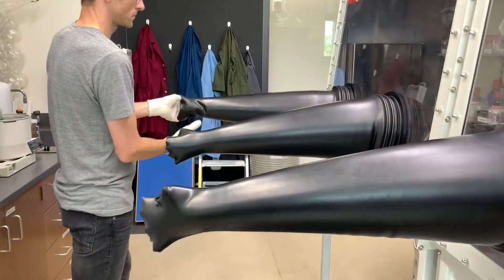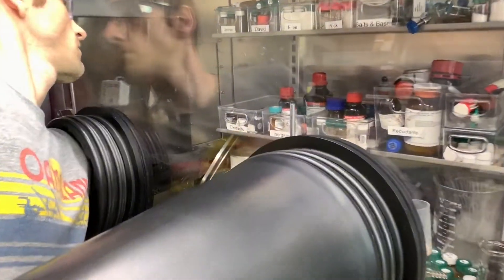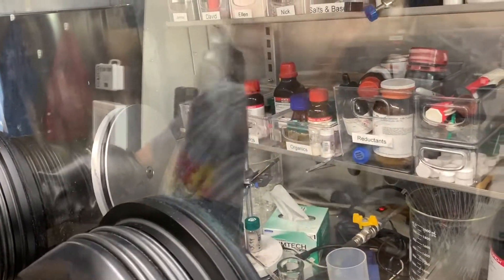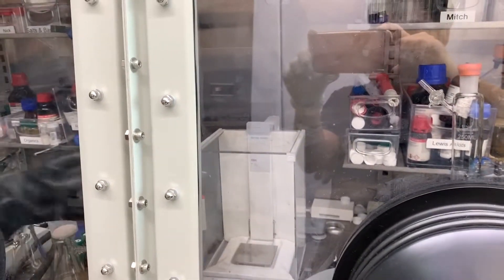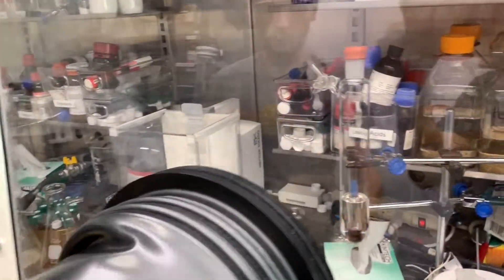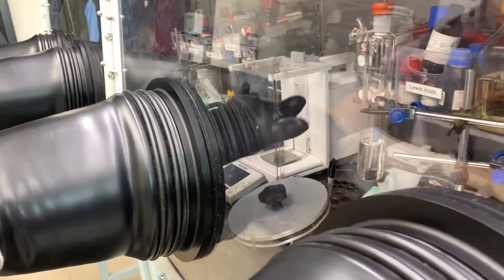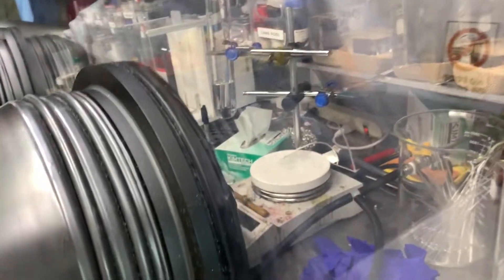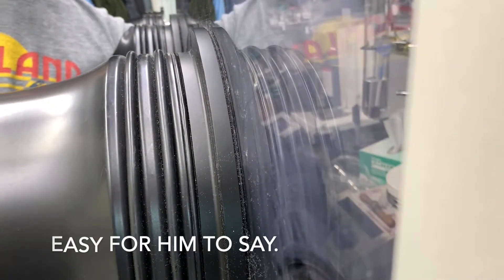In this case, the glove that needs to be replaced is on the far side of the glove box. Mitch will work quickly to move the porthole cover over to the other side, and using the neighboring glove, he holds onto the knob and shoves the metal plate firmly into the port of the compromised glove. Working quickly, that takes only about 30 seconds, so don't panic. Just be smooth and calm and avoid creating any other safety issues.